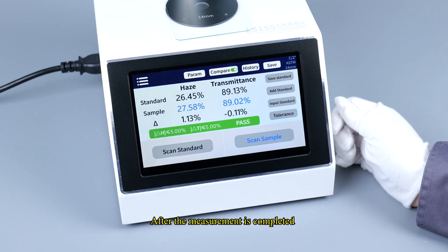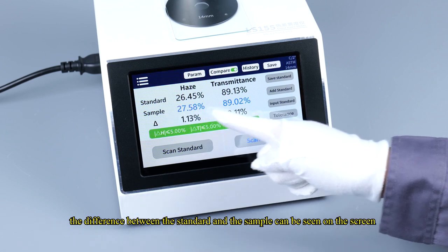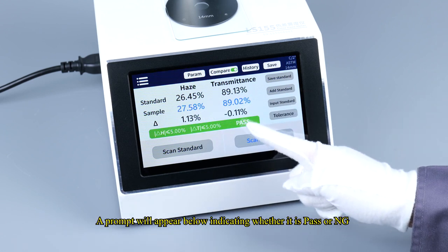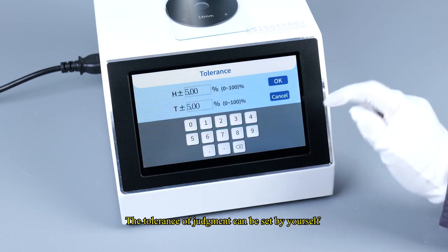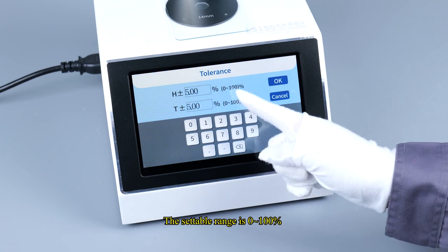After the measurement is completed, the difference between the standard and the sample can be seen on the screen. A prompt will appear below indicating whether it is Pass or NG. It will show green if it is qualified, red if it is not qualified. The tolerance of judgment can be set by yourself. The settable range is 0–100%.